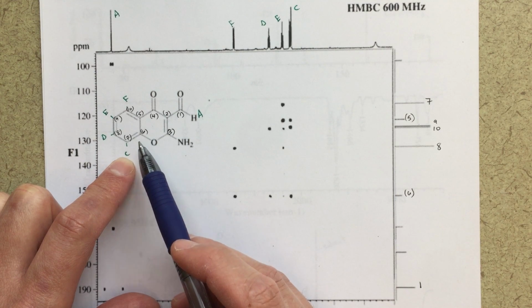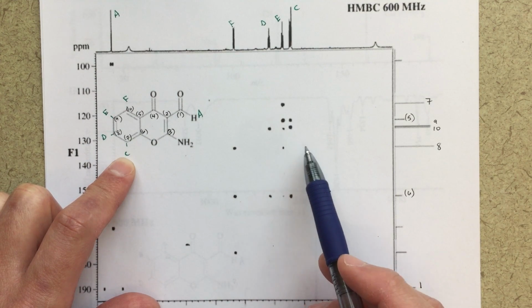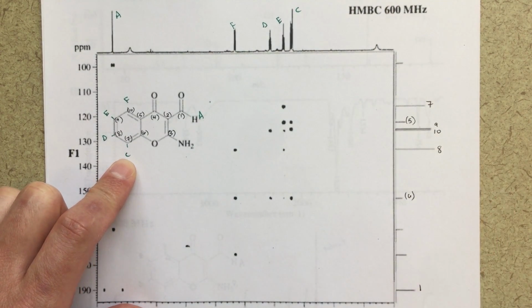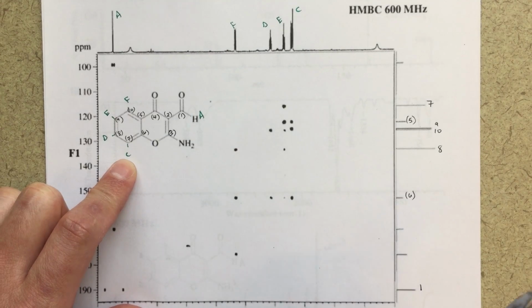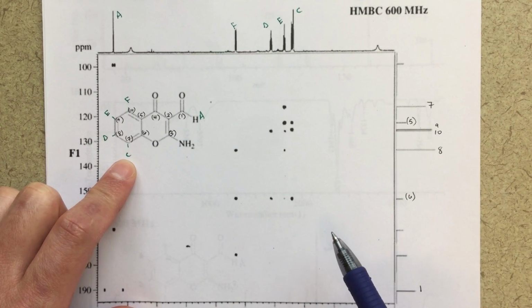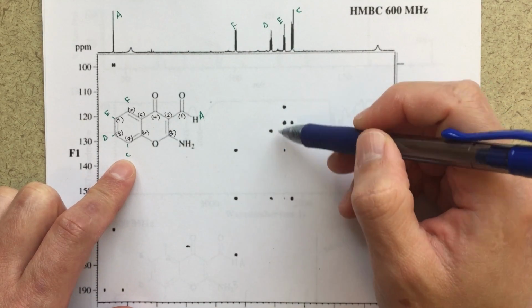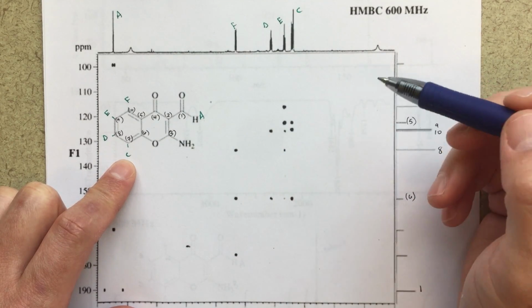There could be another correlation there. We're not seeing this correlation here for 8. Could be a variety of reasons for that, but I think that's okay. We just want to make sure that the things we are seeing, we can make sense of. E looks a little bit complicated, so I might skip over that one at first and just use that to sort of confirm things a little bit later on.